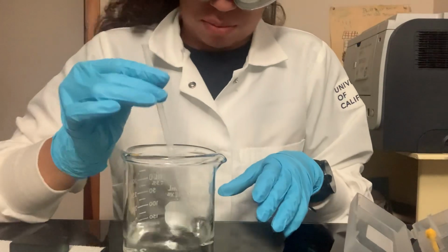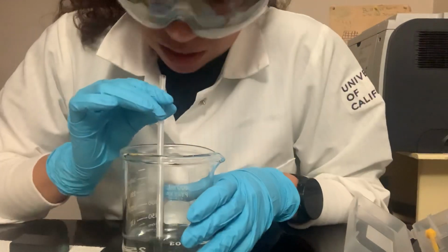I'm going to go one more time just to make sure that we see a pH change.